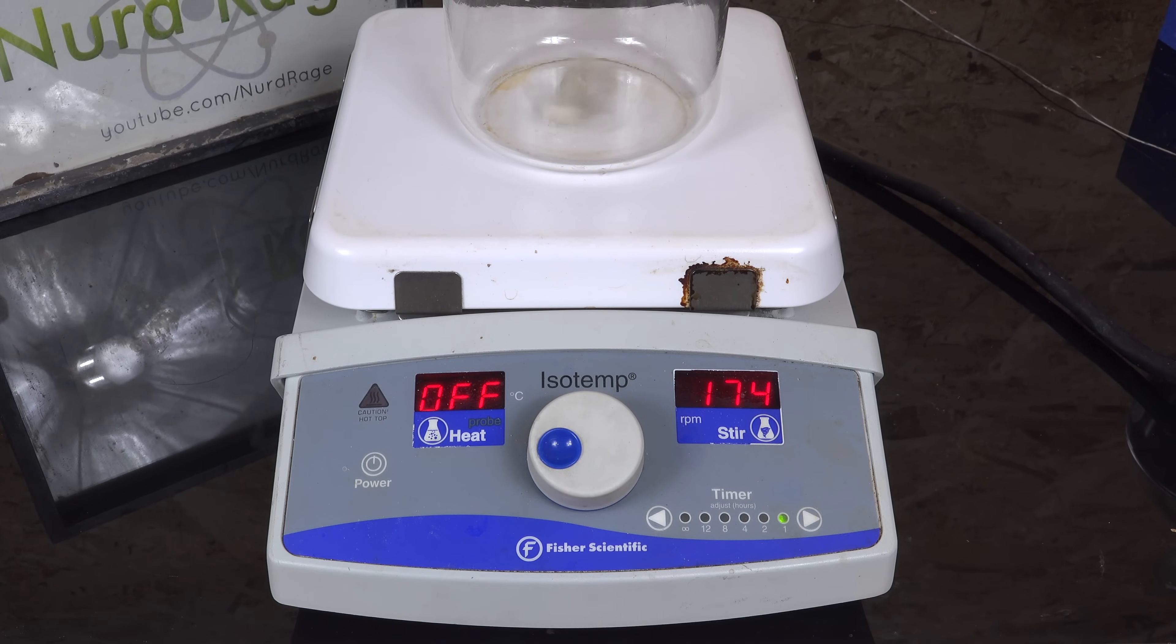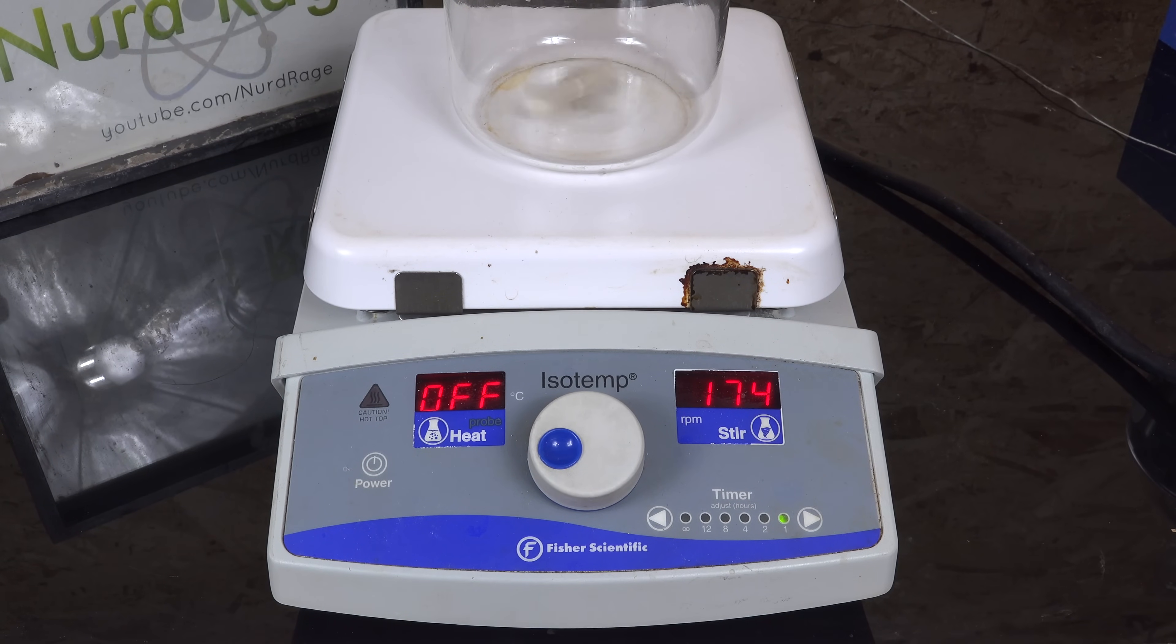At this point I want to thank the viewer that donated this particular hot plate stirrer those years ago. I really appreciate it. This is such an awesome unit that I actually use it very rarely because I'm afraid of breaking it. But when I do use it, it absolutely demolishes my other hot plate stirrers. Anyway, this is what we'll be using for heating.